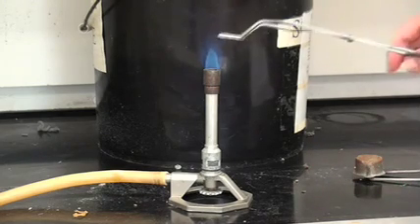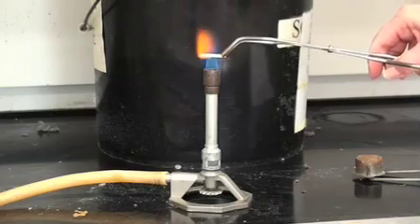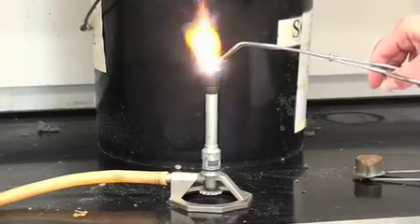At this stage of the game, I'm going to put in a piece of magnesium and immediately you'll start seeing it. And look at that.